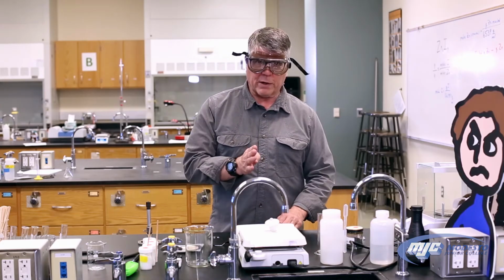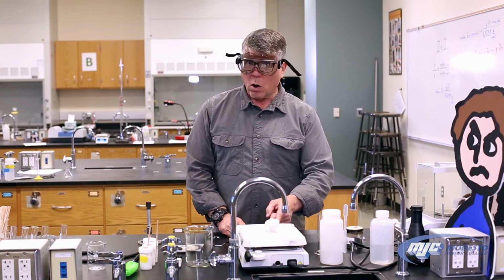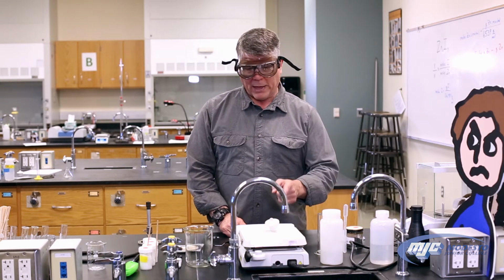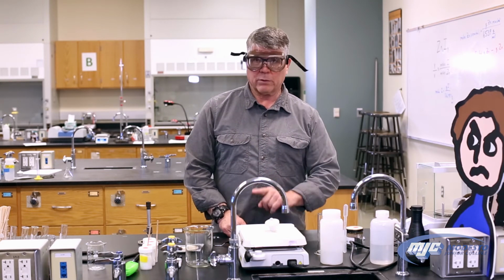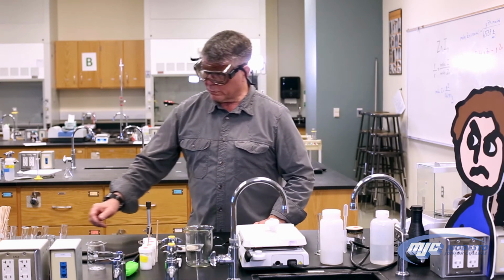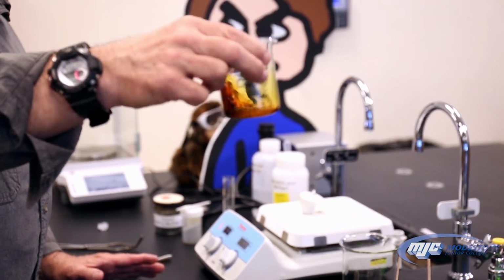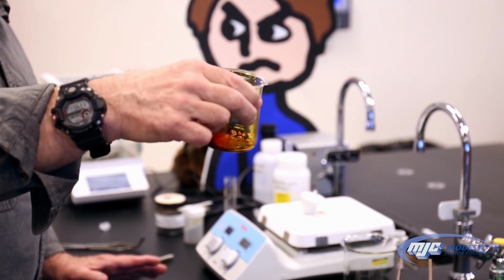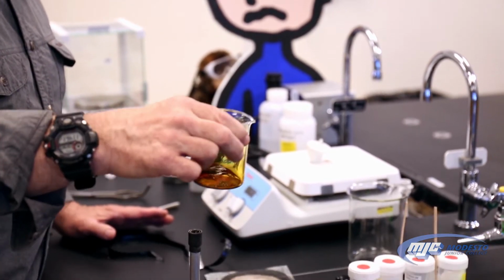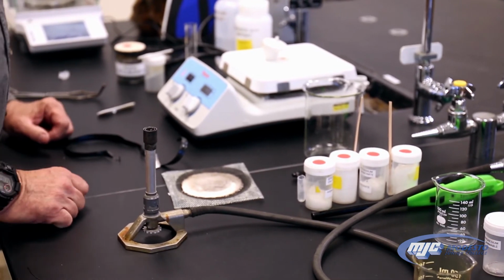So after the first 5 minutes, what we're going to do is turn the heat up all the way and let it stand there for 15 more minutes. At that point, we'll take it off and weigh it. So we'll get to that in a minute. While we're waiting for this to happen, let's go over and look at our zinc iodide. See how it's gotten a dark red color? The iodine is starting to dissolve, and now we're waiting for it to all react with the zinc. So set that aside. What we can do now is the flame test.